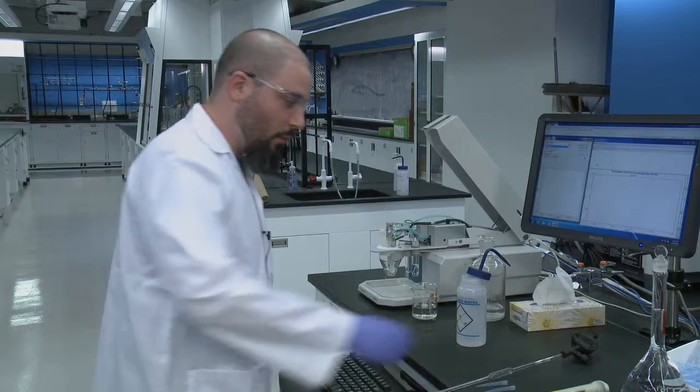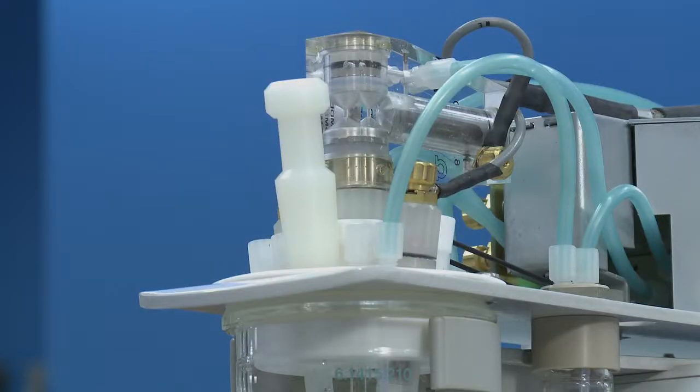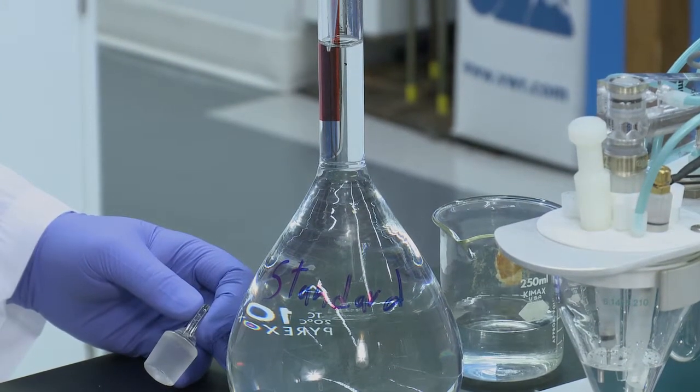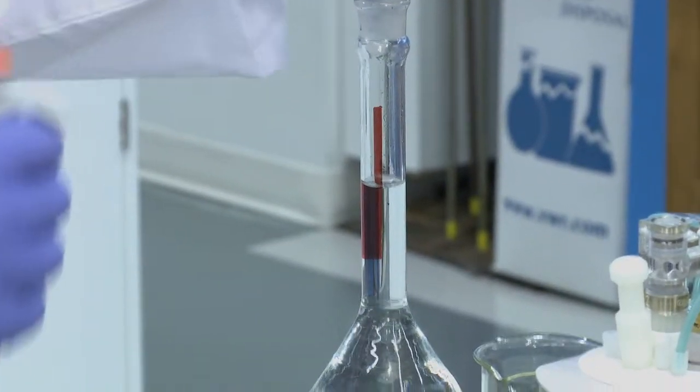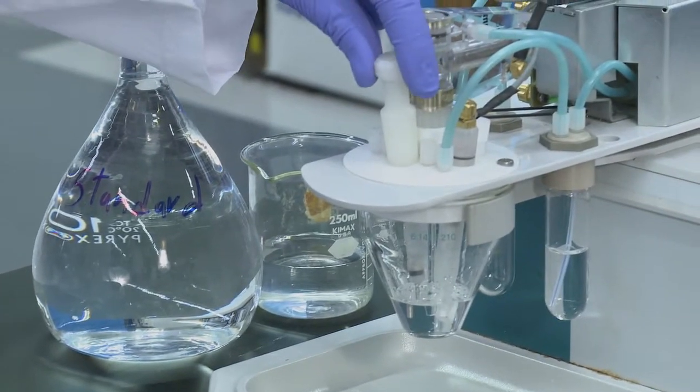At this point, you'll want to inject 100 microliters of your standard through the injection port located on the top of the instrument. So prepare your 100 microliters of your standard first.